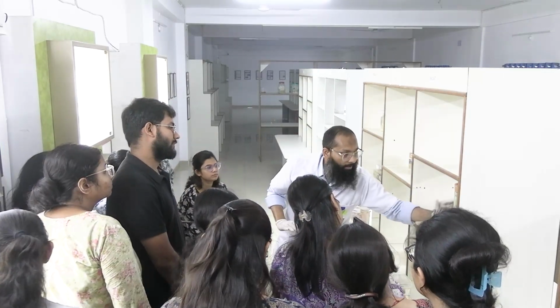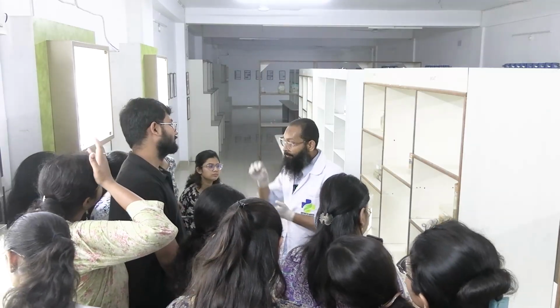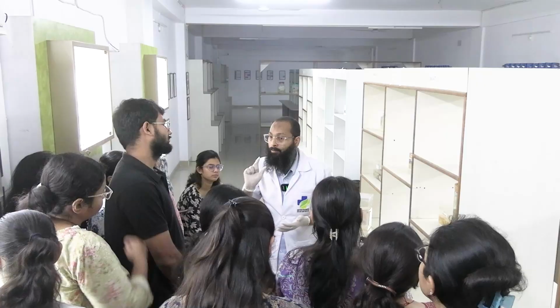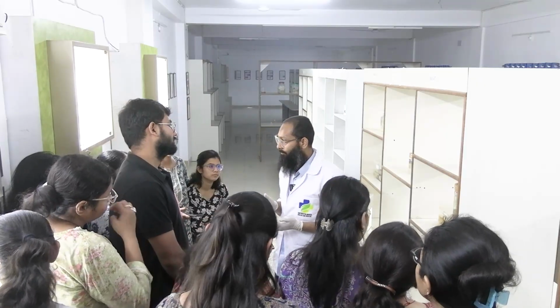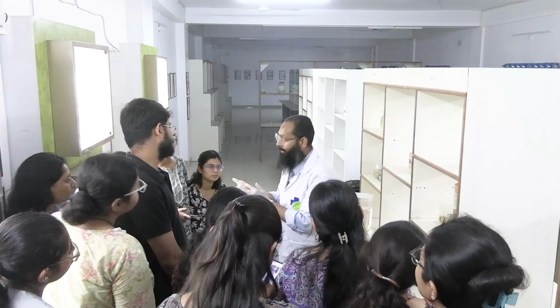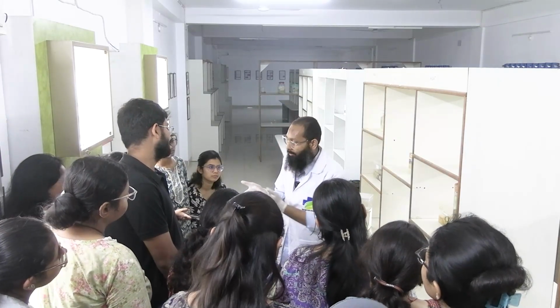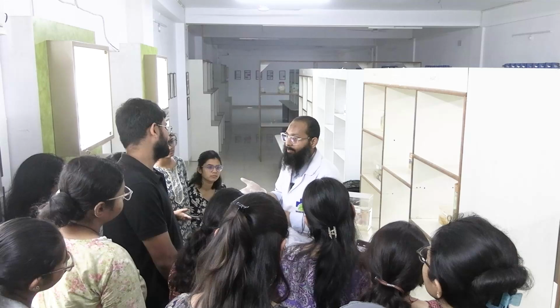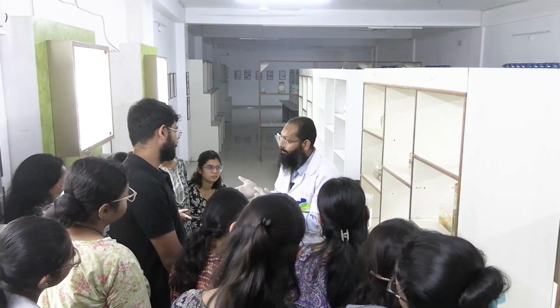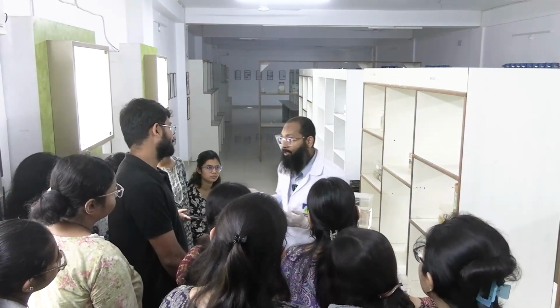So these are the resection margins, and if there is a tumor which is located on the resection margin, that means the surgery was not adequate, ঠিক আছে? Suppose there was a tumor of this size, okay, surgeon didn't understand, he thought that the tumor is of this size, fine, but it was actually of this size. Now he cut it out. পরে কি ক্ষতি হবে পেশেন্টের?